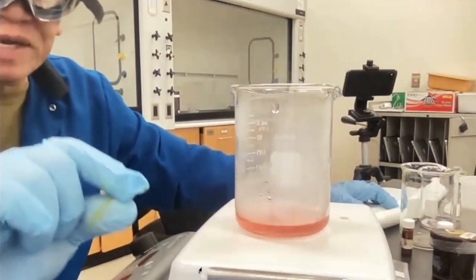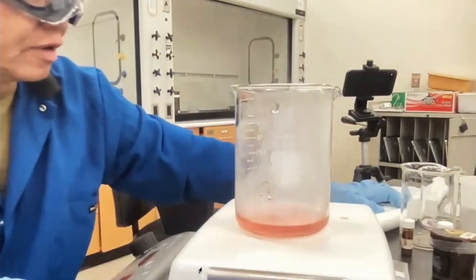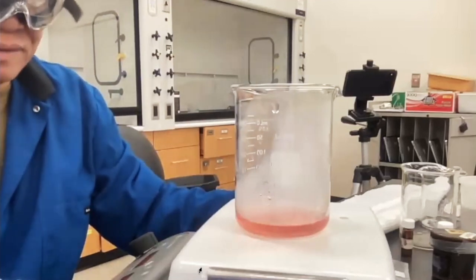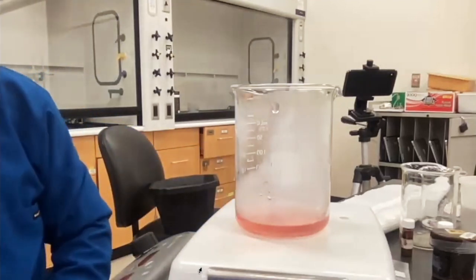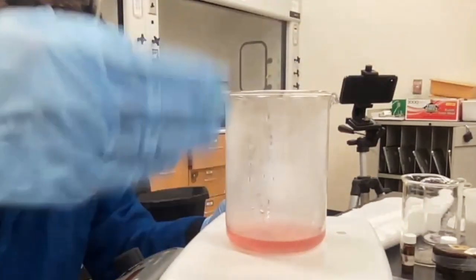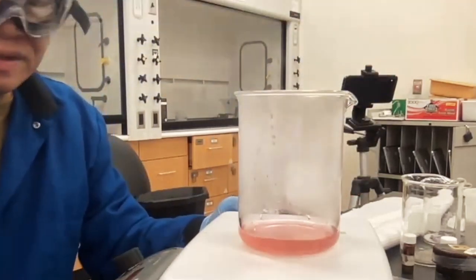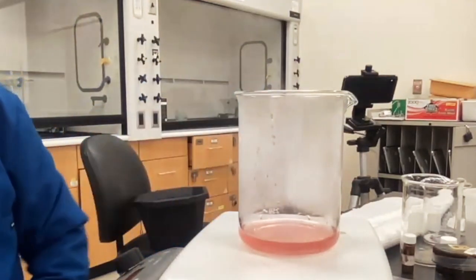That's why I said use a minimum amount of water, because if you use too much, then you're going to be boiling for at least an hour or half an hour. So minimum amount is all you need. Okay, so I've got this cranked up, and now it should be getting to the point where that water is starting to boil. And you see how it starts to fog up here? And that's bad because you guys can't see that, of course, but you get the idea. So give this about 5 minutes.